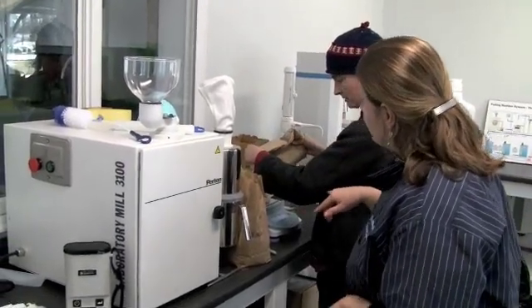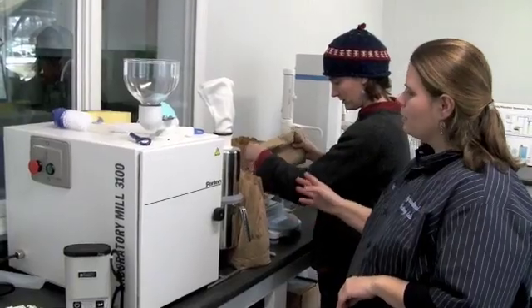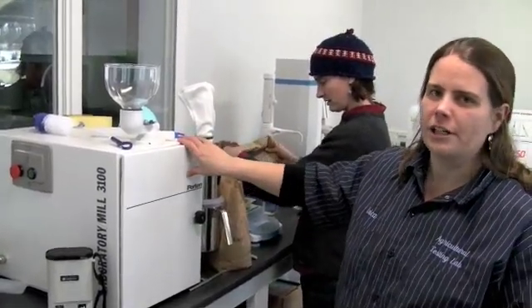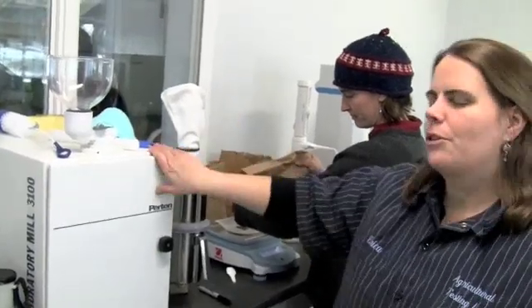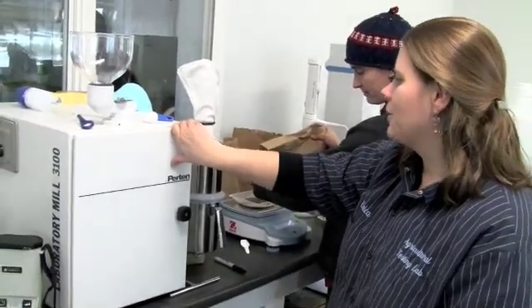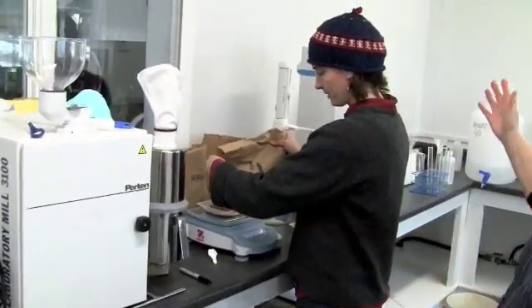Right now Susan is weighing out 300 grams of wheat seed, which will then be put through the grinder and milled through the special lab mill, which will then go to the falling number.